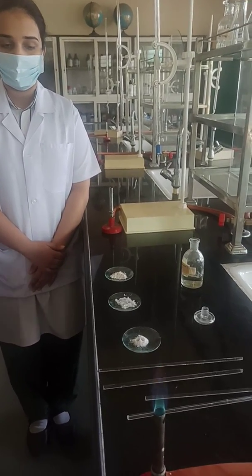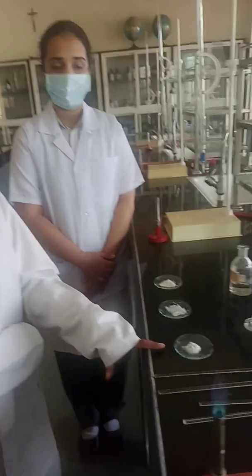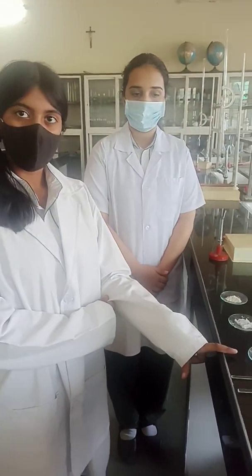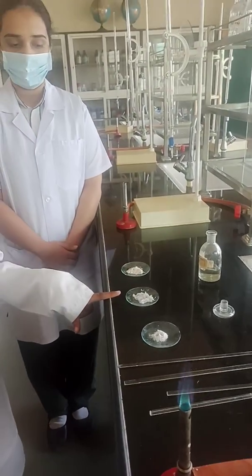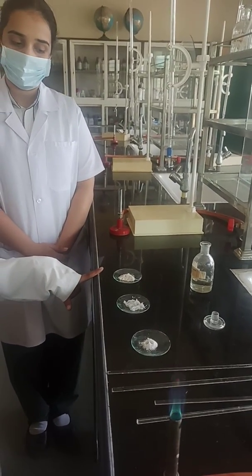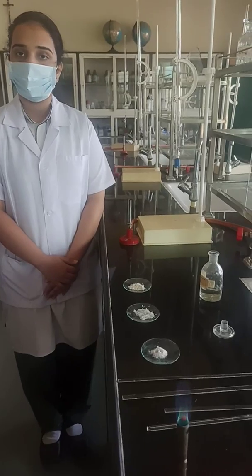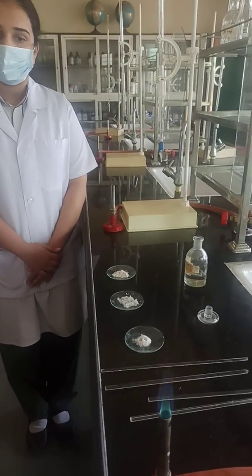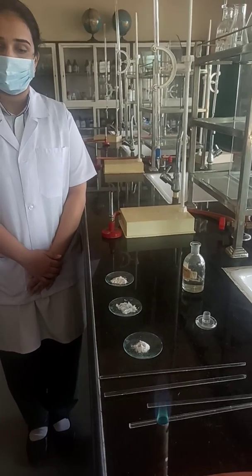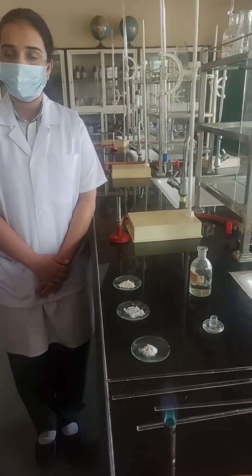Asmi, can you start? First of all, what are you going to do? Barium. Yes. Barium gives apple green colour. And strontium gives crimson red. And calcium gives brick red colour. So she is going to introduce these salts one by one to the flame and we can see what all colours she is telling.